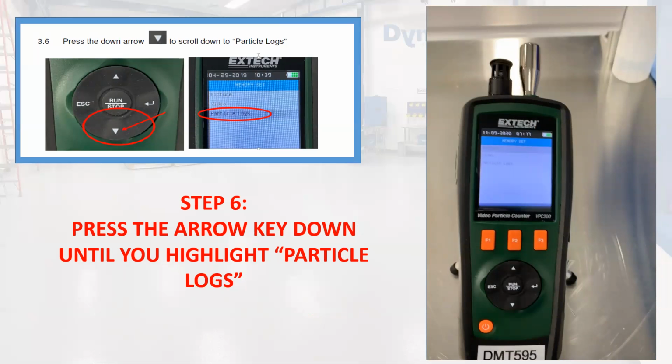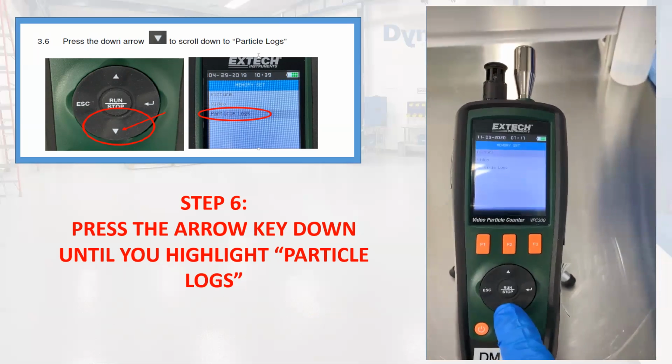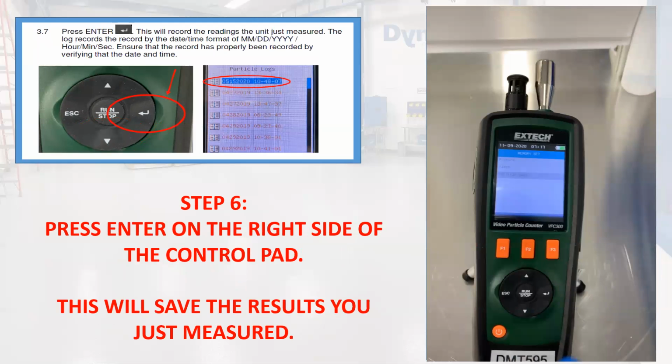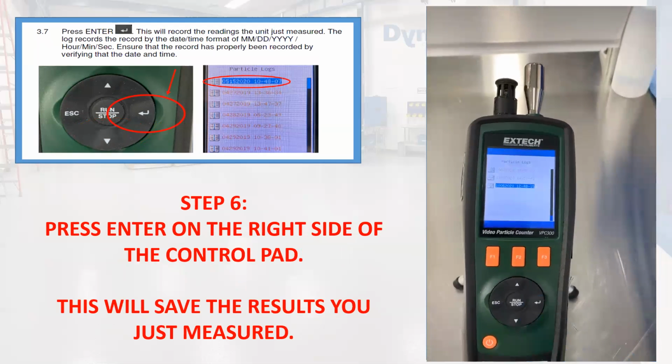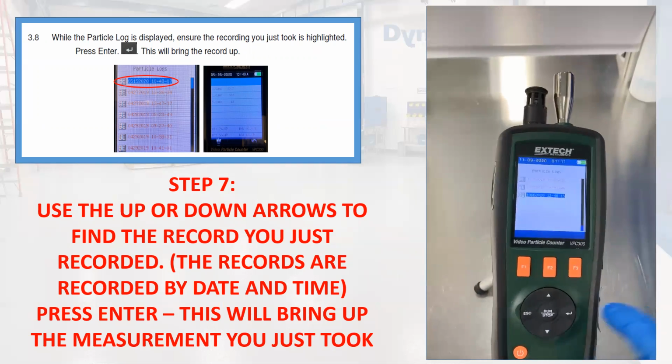Press the arrow key down until you highlight the particle log menu. Press enter on the right side of the control pad. This will save the results you just measured. Using the arrow up or arrow down, find the record you just recorded. The records are recorded by date and by time. Then press enter, and this will bring up the measurement you just took.